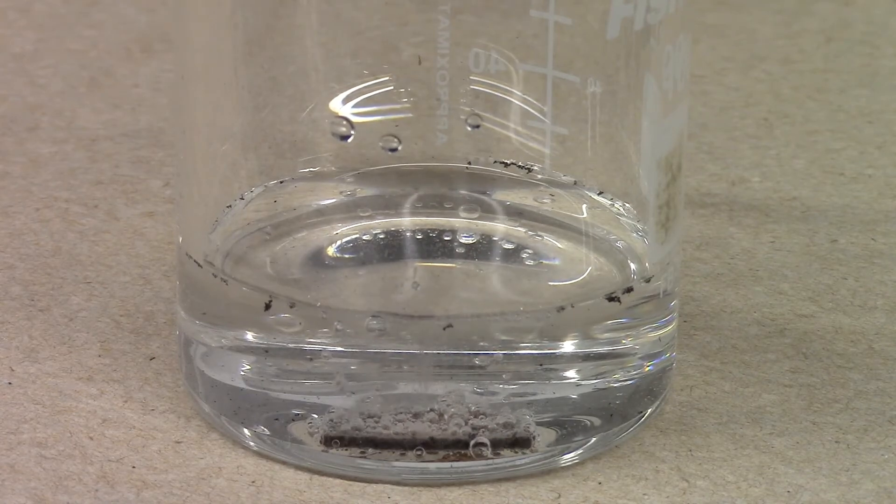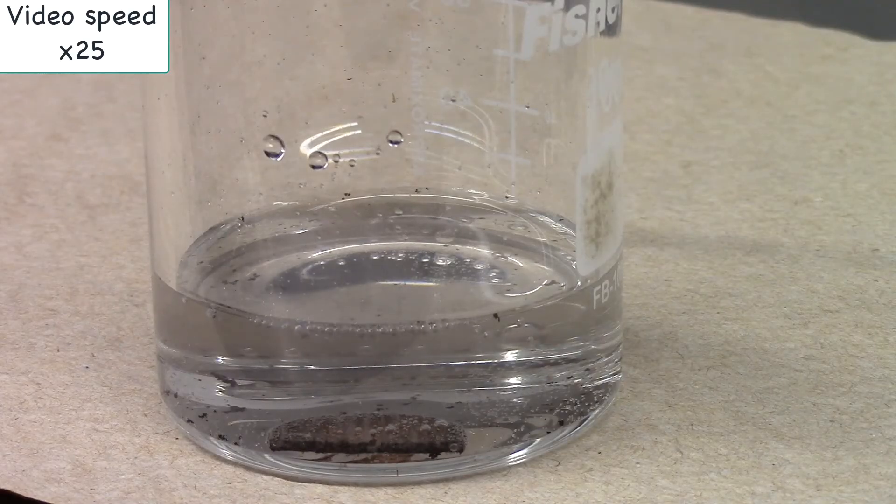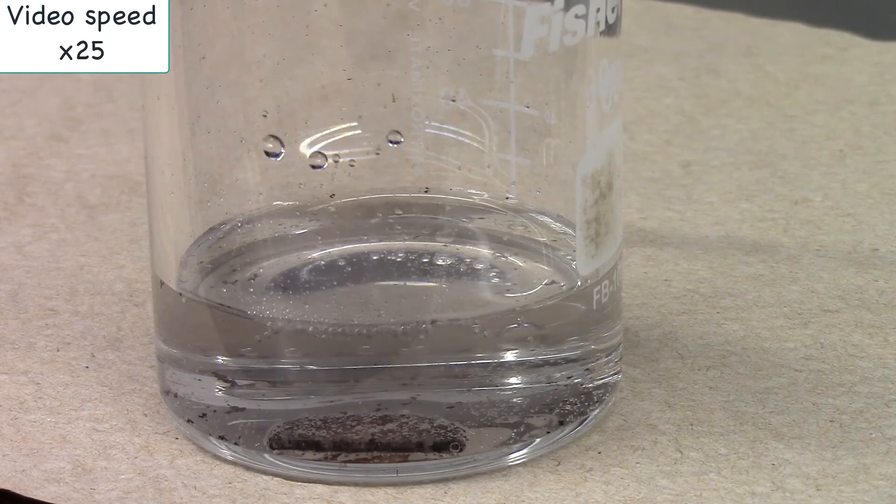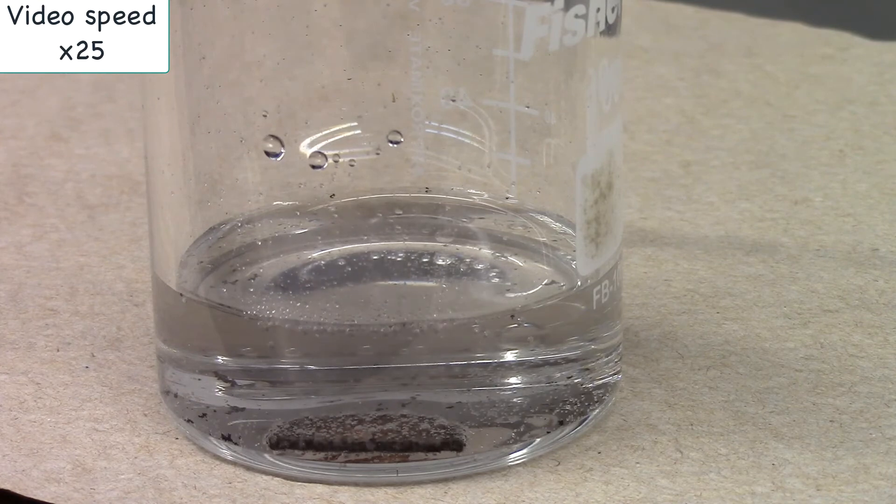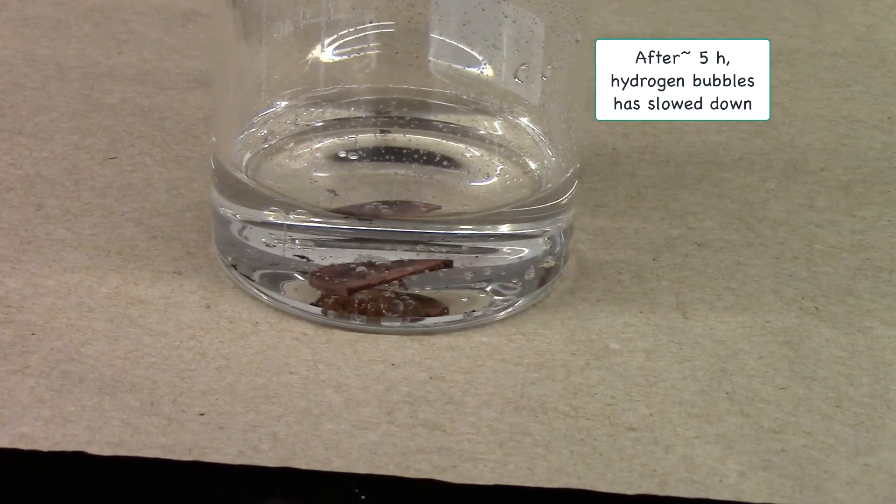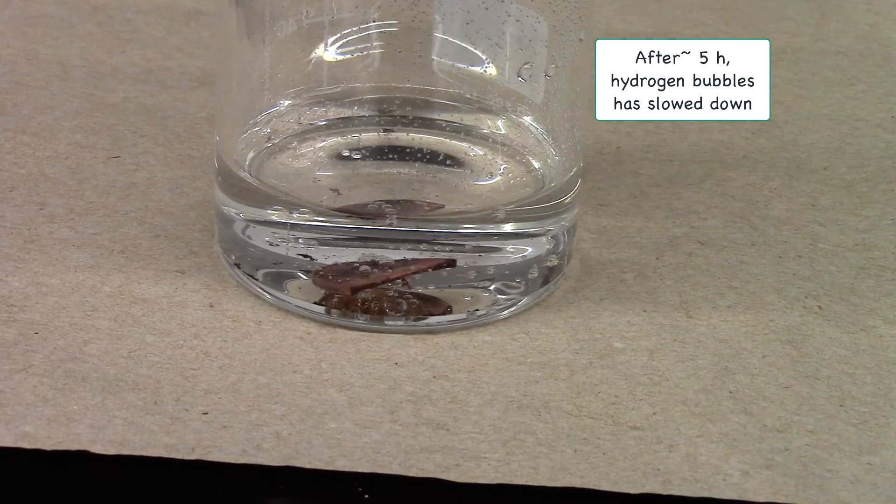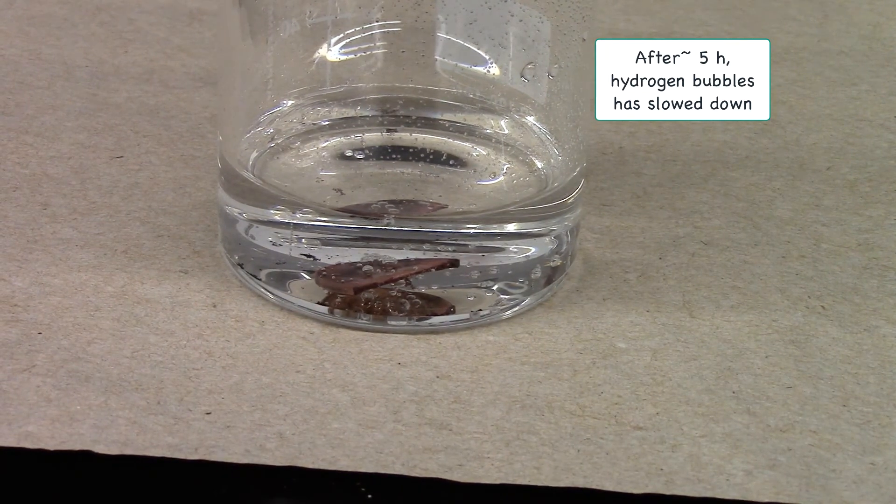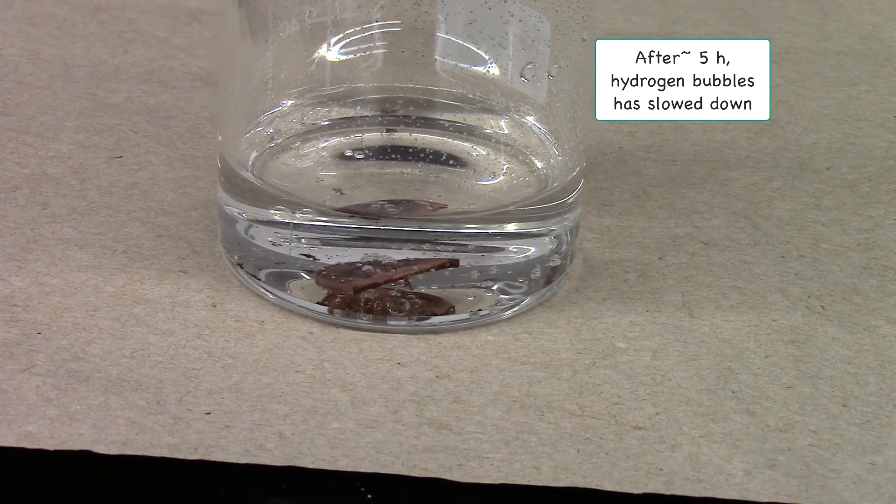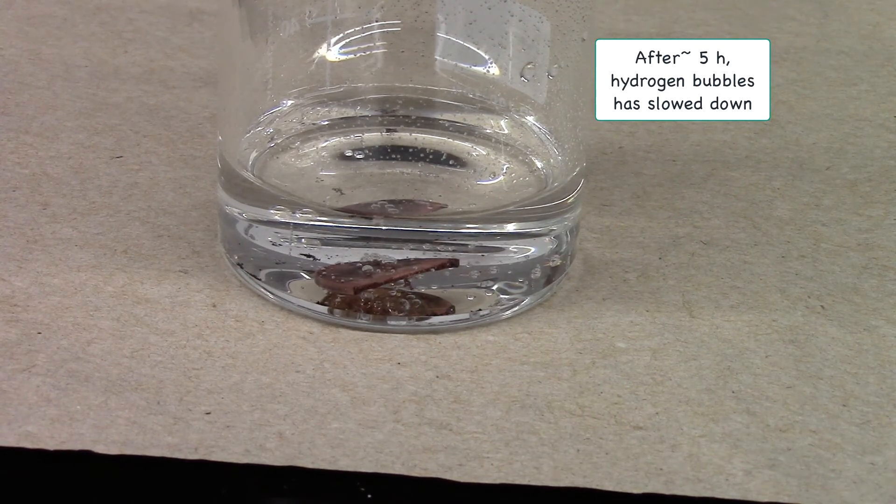We'll let the coin react for a while. So I'll let this react for about five hours. And you still see some gas bubbles coming which is hydrogen gas. But we are going to go ahead and take it out.